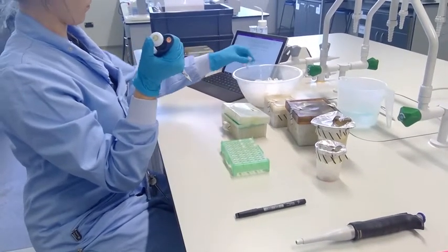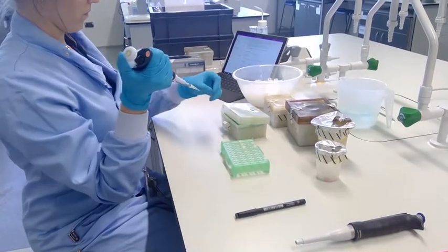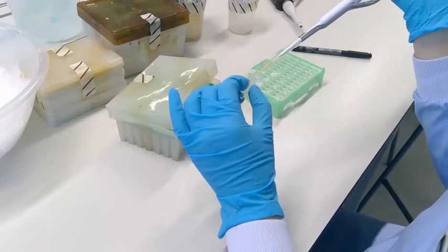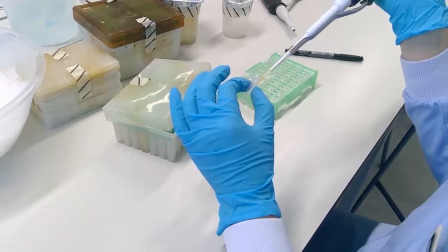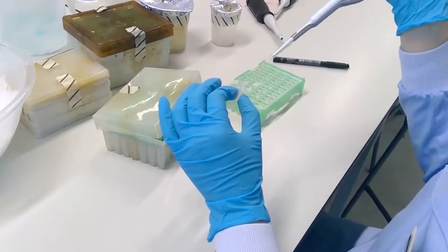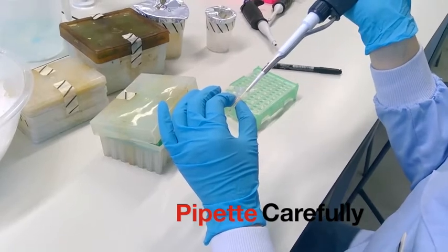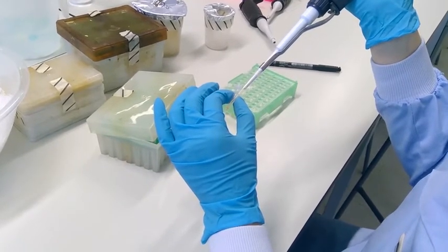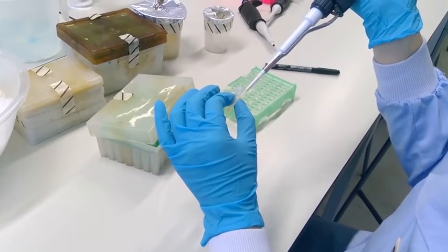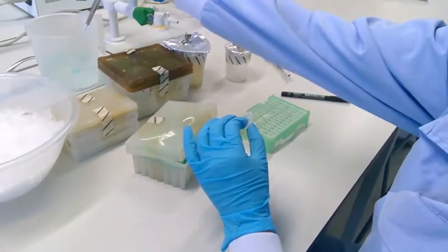Remember you need to add 25 microlitres of your MasterMix into each tube along with the corresponding primers, and lastly — the most sensitive and important — your cDNA. The first thing you do is have all your samples ready on ice, then add the highest volume, which is the Mango MasterMix, containing magnesium chloride, dNTPs, and buffers to maintain optimal PCR.